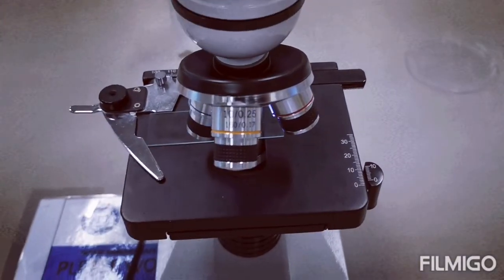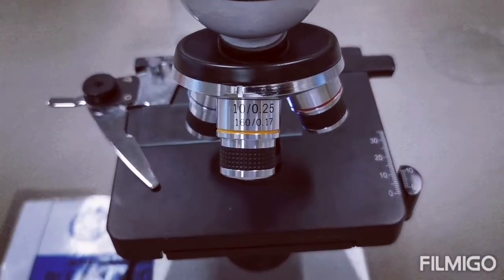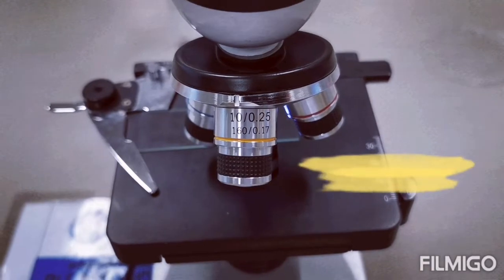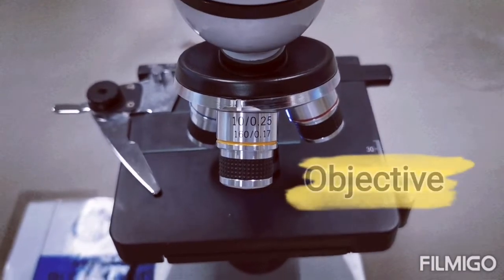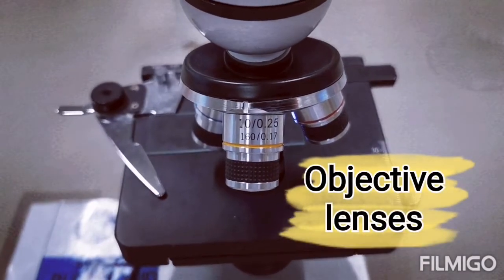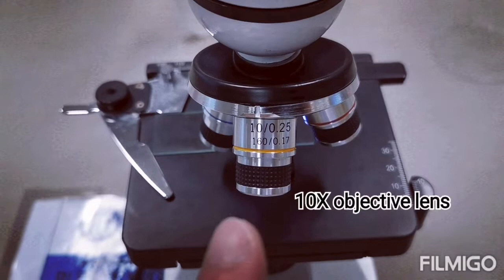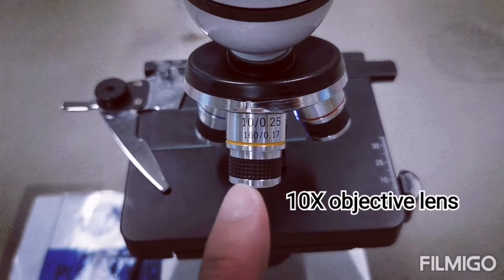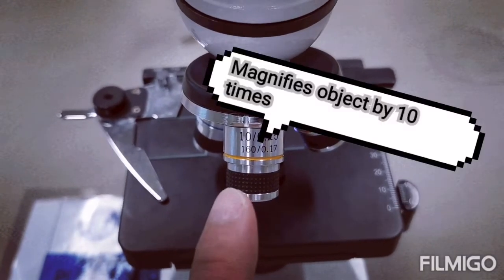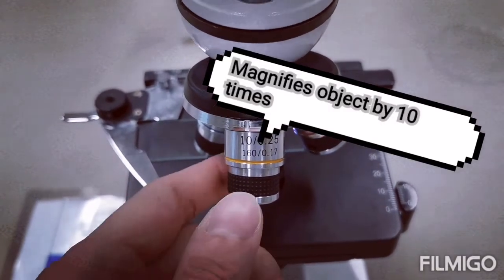Moving down, this rotating knob of three different lenses here is known as the objective lens. We have three different types of objective lenses. We have the 10 times objective lens, also known as the medium power objective lens, that magnifies the object by 10 times.